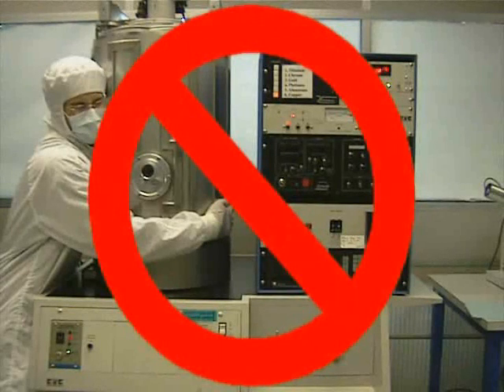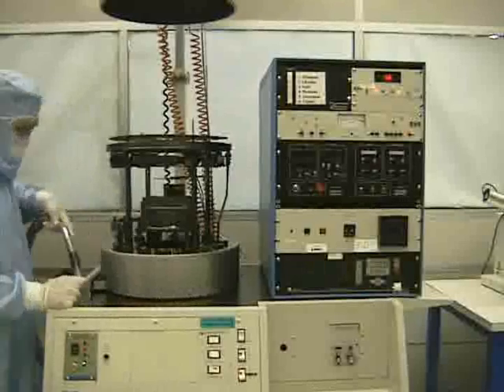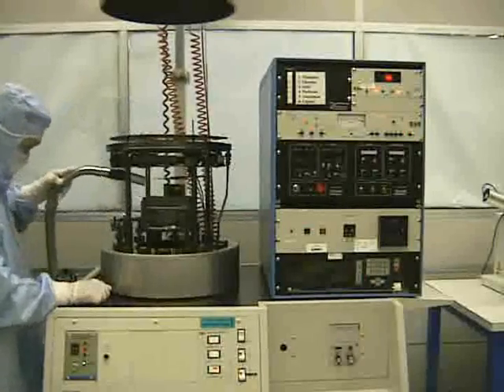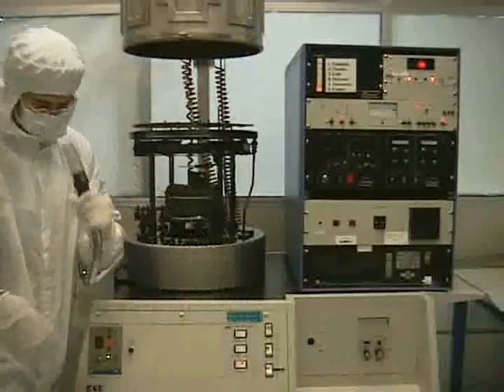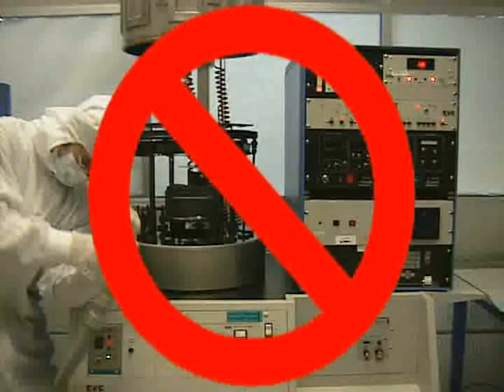Do not try to hoist up the chamber before the chamber is completely vented, and be sure to use the hoist up button instead of using your strength. Clean the area by vacuuming any flakes or debris that have been left on or around the chamber. Cleaning the area helps create a better seal between the metal and the rubber. It is very important to vacuum the area. Do not forget to do it.